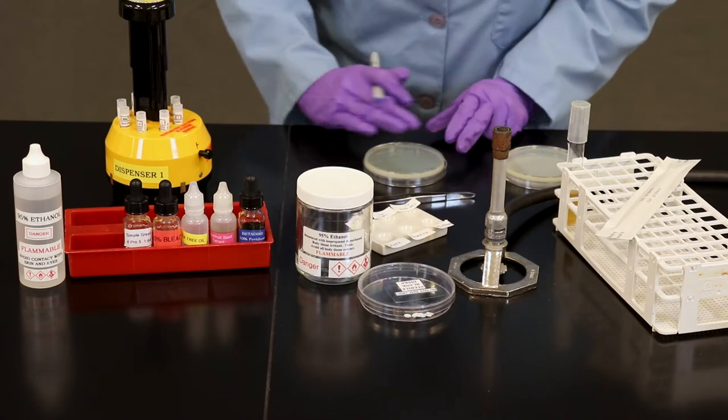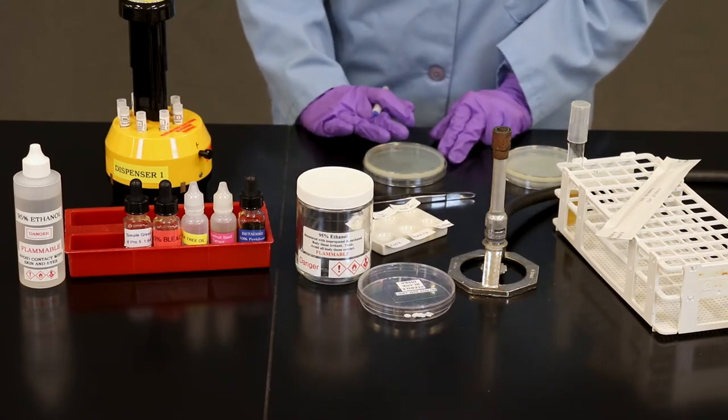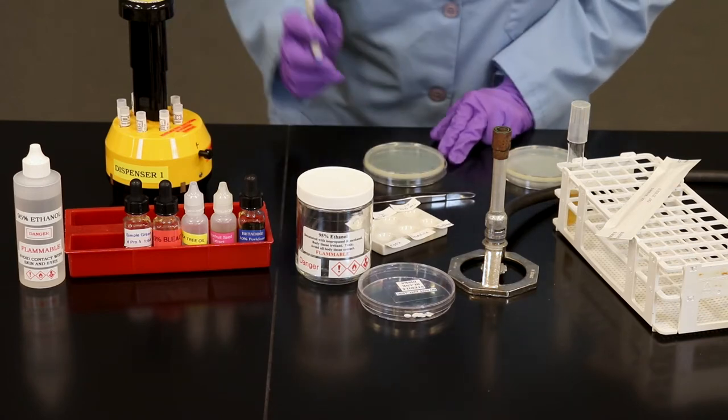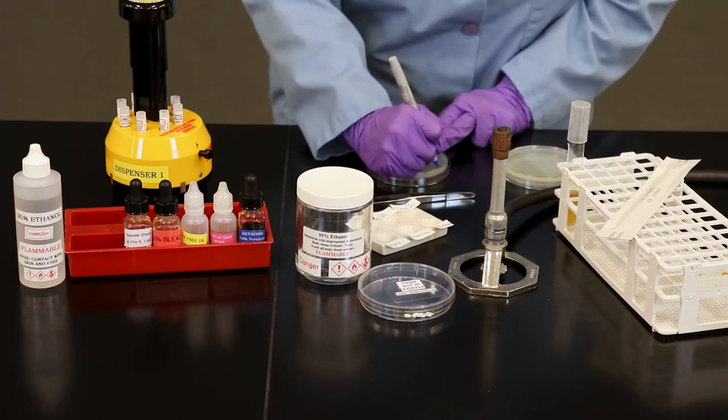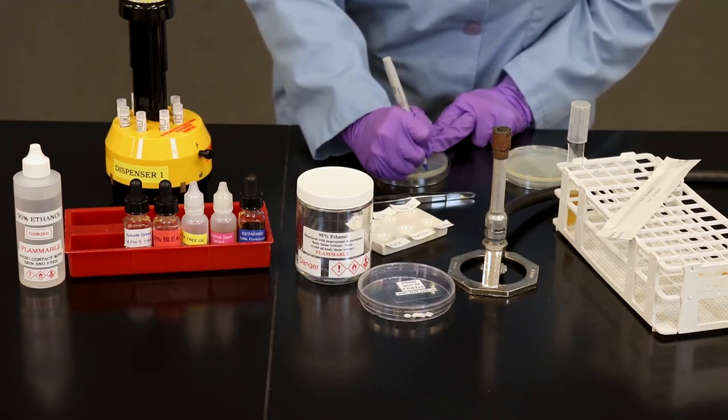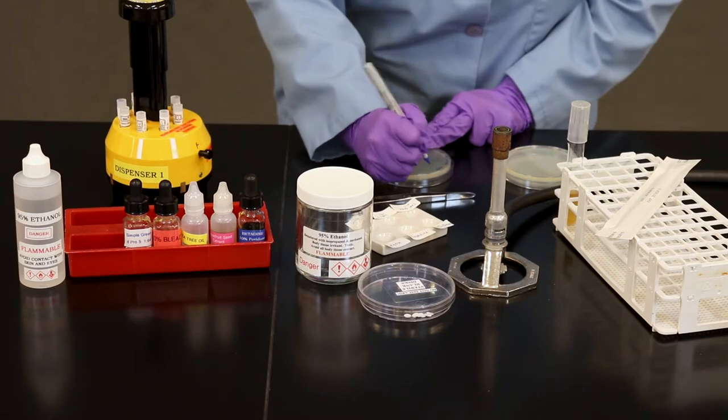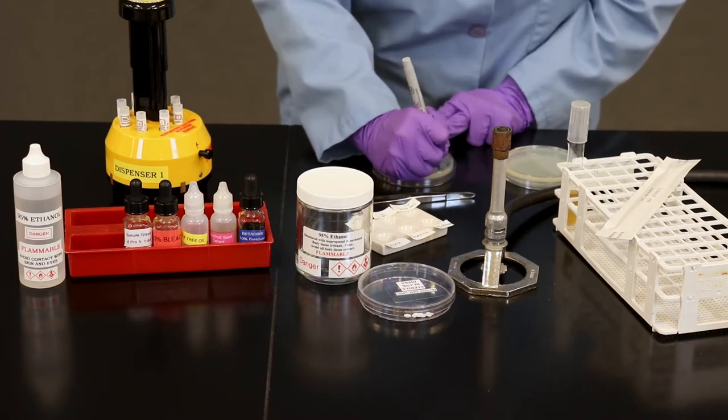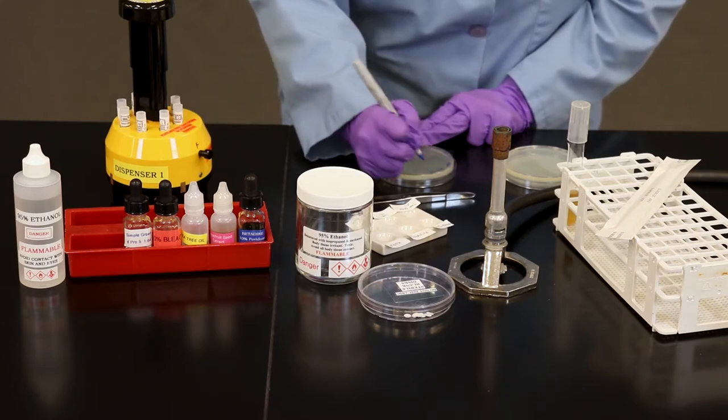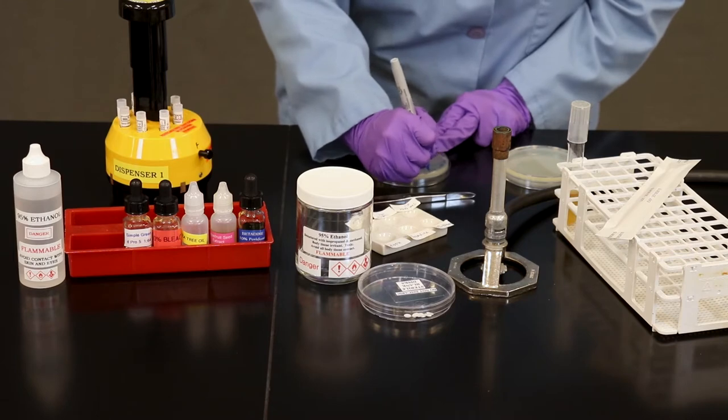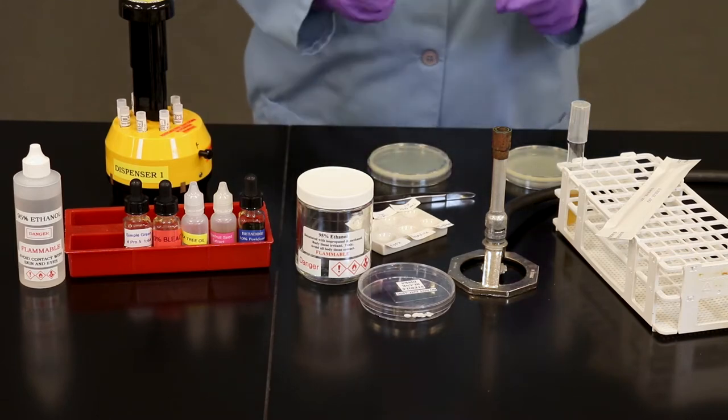On the second petri plate, we're going to label the same information, but we're going to note antibiotics. Once your plates are labeled, you're ready to get started.